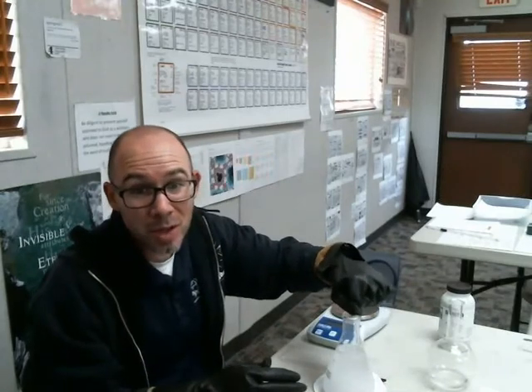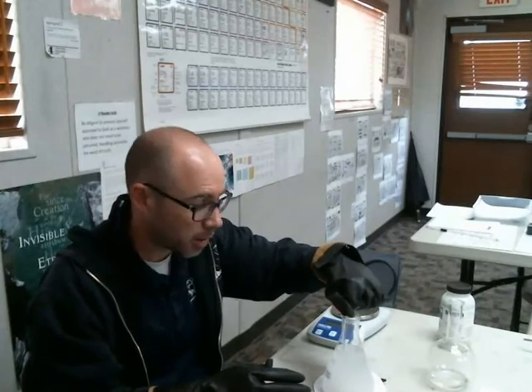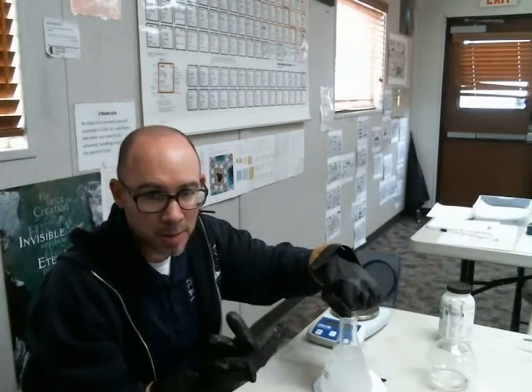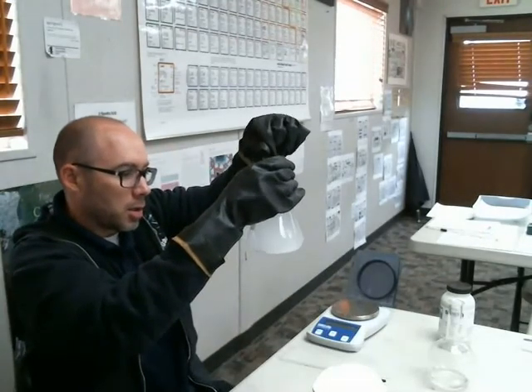So then we just stir like crazy, or if you're in a really nice lab, you put it on a hot plate, which has you drop a little magnet thing in there, and then turn the spinner thing on, and it'll spin, and it'll stir itself. And then just there we go.